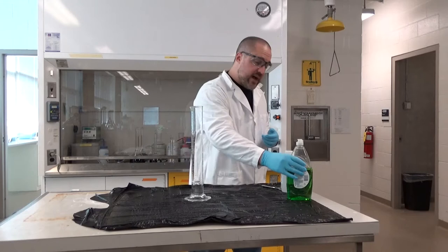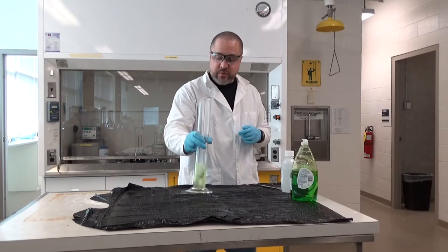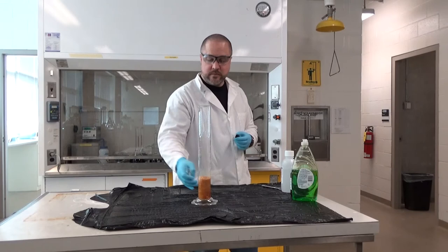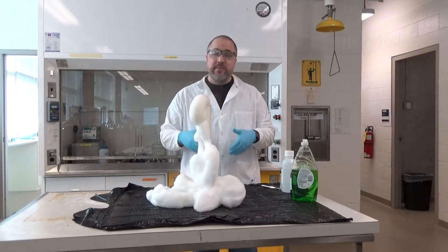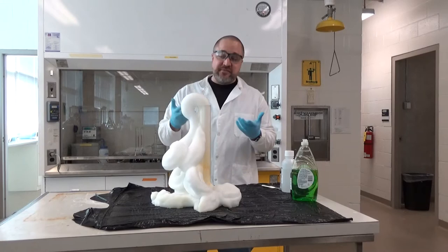I'm going to add some soap. The soap does not take part in the reaction, but it will make for a nice effect as you'll see in a moment. Now I'm going to add the catalyst — potassium iodide. All the catalyst does is speed up the reaction. As you can see, the reaction is speeding up: the peroxide is degrading into water and oxygen at a much higher rate. The soap traps the escaping gas and makes this nice foam. This reaction is called elephant toothpaste because it kind of looks like what would be left over after you brush an elephant's teeth.